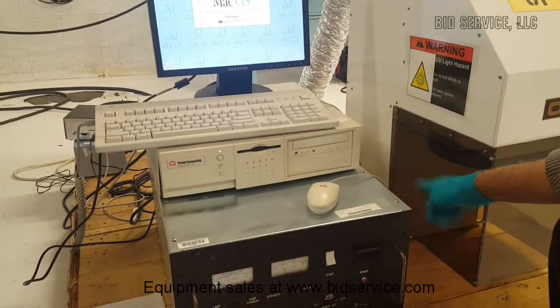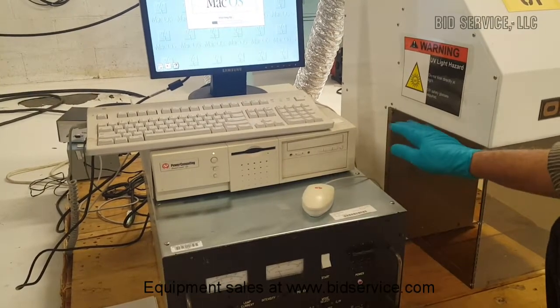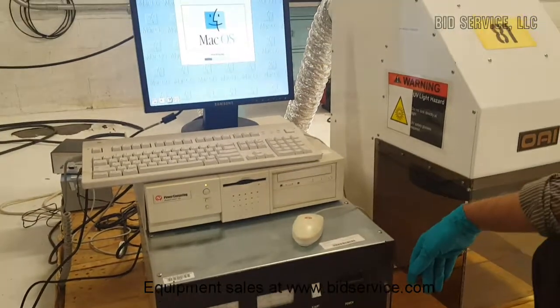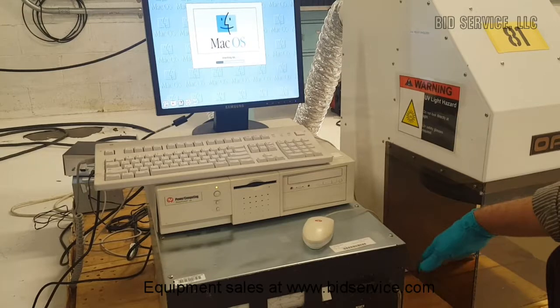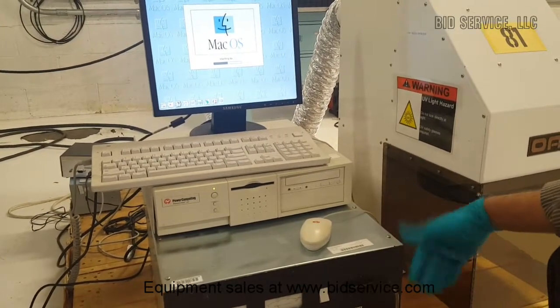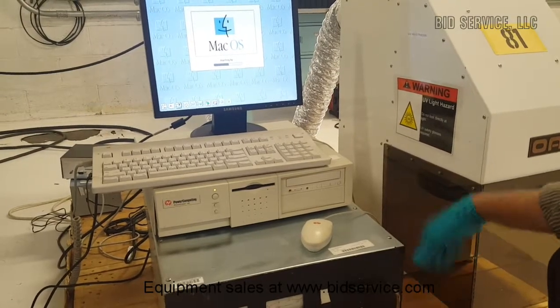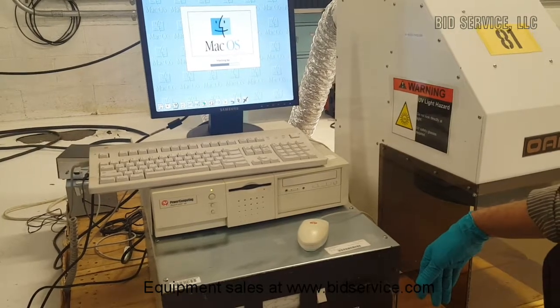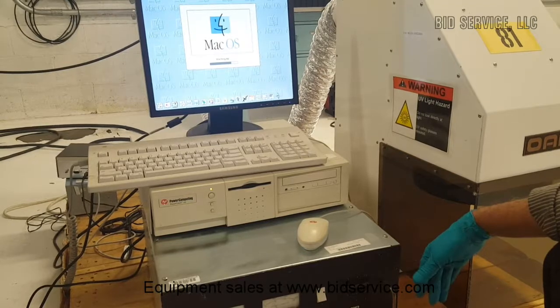The PC is interfaced to the shutter in the lamp housing so that the exposure could be made in terms of energy levels. So the dosage, how much energy is desired, can be entered in the PC, and the shutter will open for a few times to achieve the energy level.